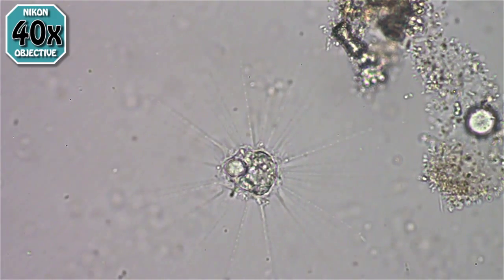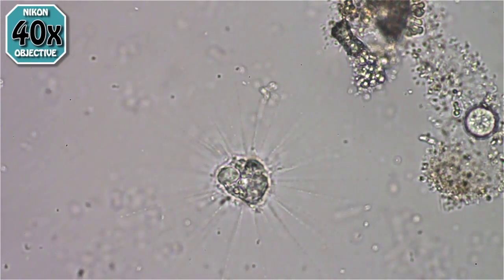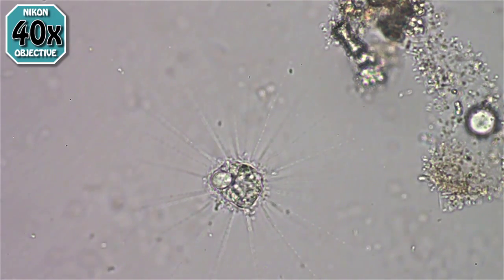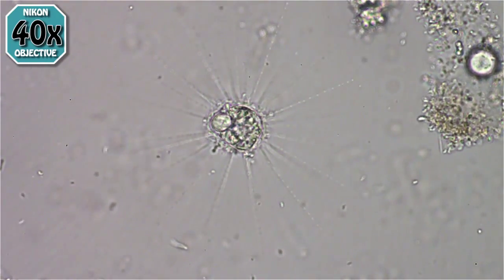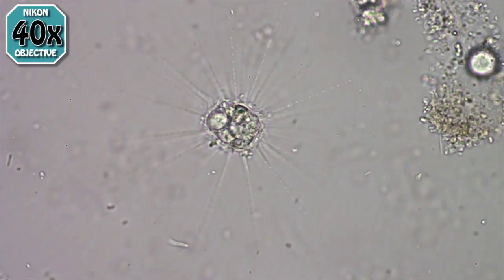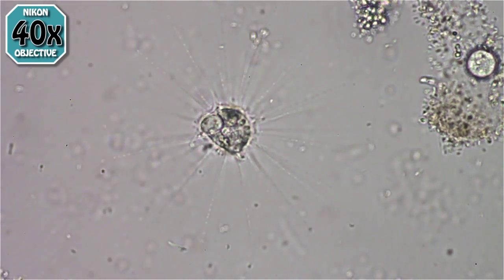Definitely much better than watching it in a little screen. This is a heliozoa, Actinophrys. It is a rather common heliozoa, which is a type of amoeba. The spines you see here are specialized pseudopods that it shoots out, and the little dots on them are digestive fluids that it secretes — they run back down towards the body and bring things it's caught back to the body, which it then absorbs like an amoeba.